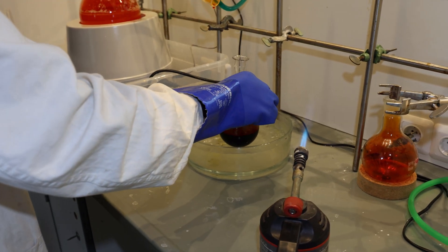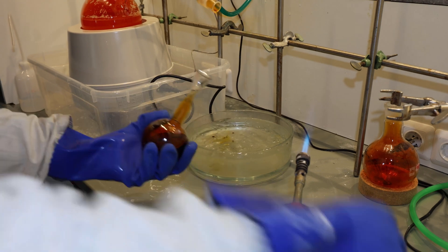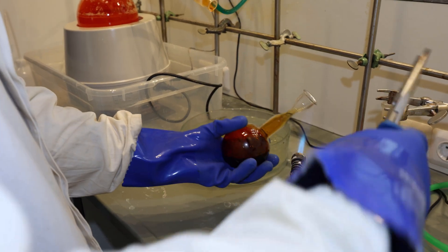We're going to seal the ampule or the container now. Hopefully this works.